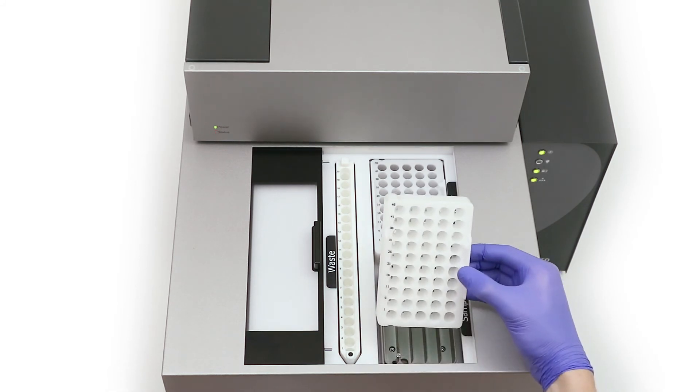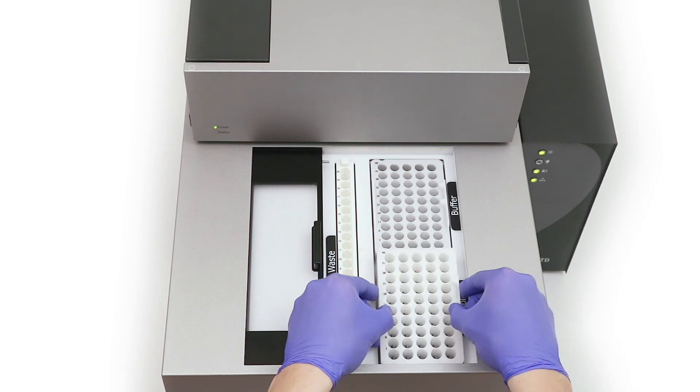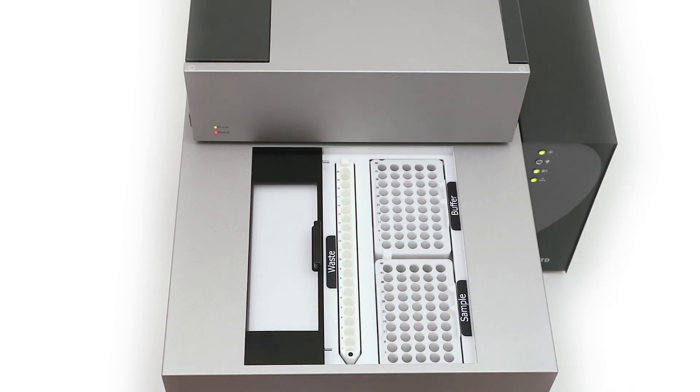The vial tray can now be inserted into the autosampler. The vial position S1 must be aligned bottom left.